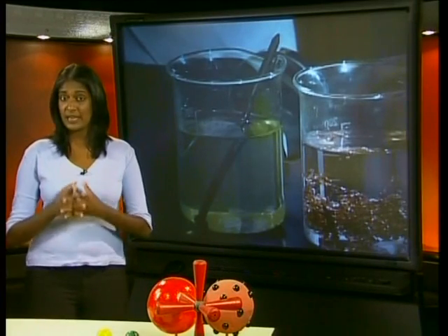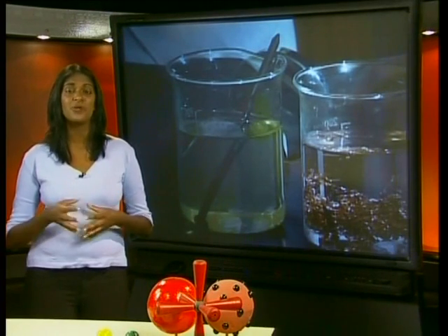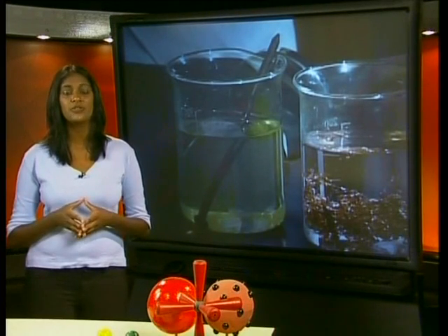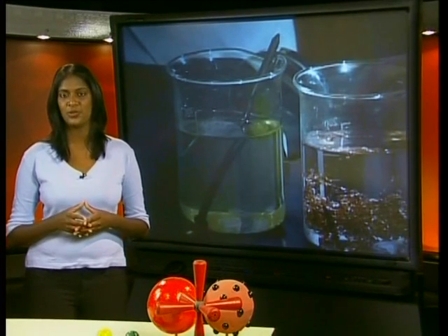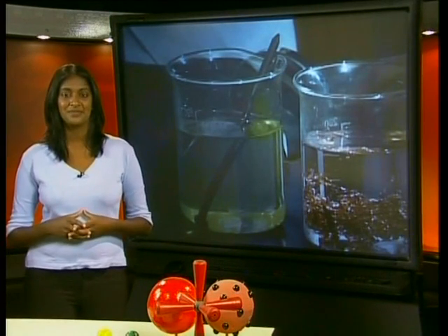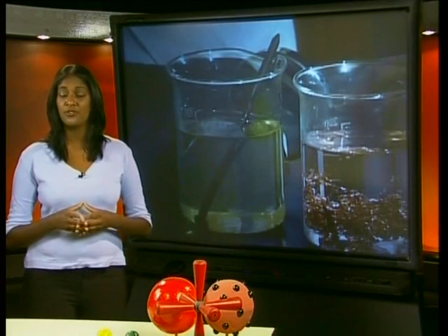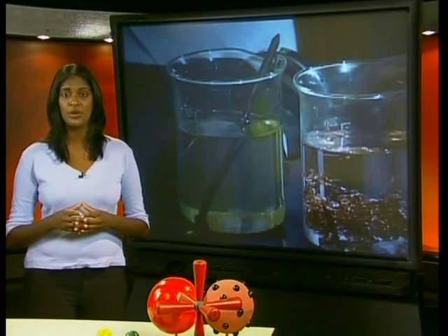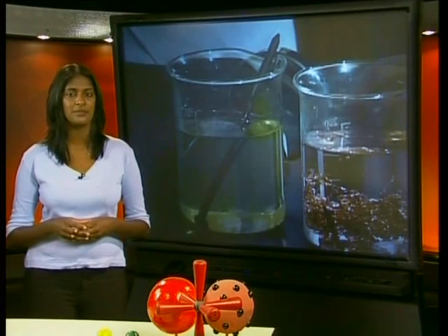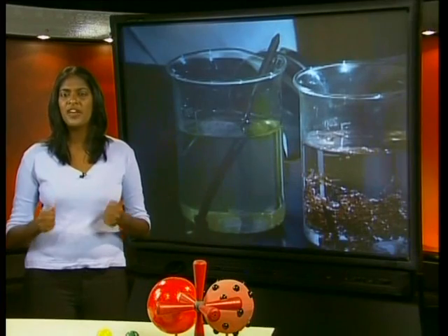So now we know that the transition metals are really a lot less reactive in water at room temperature than any of the metals from group 1 and 2 that we've looked at. You should remember from our previous series that magnesium from group 2 also showed a poor reaction with water at room temperature. Can you remember what we did to get a more vigorous reaction?